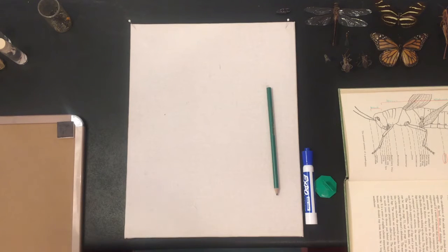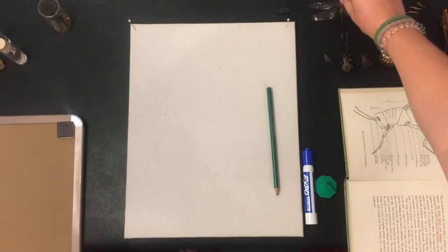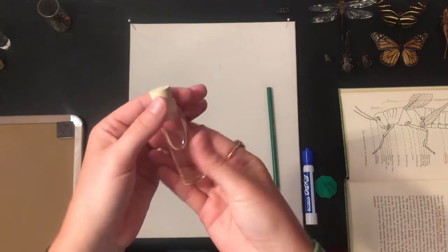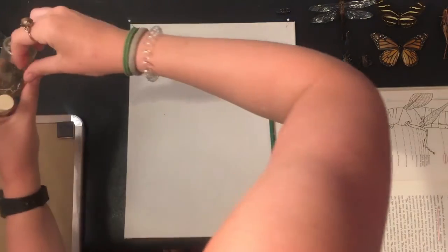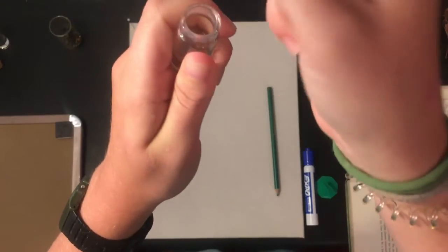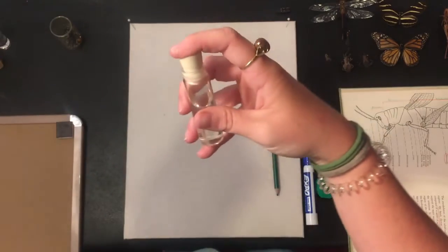Now I want to go over different types of curation, which is basically what pinning is. There is pinning, which has needles through it, and then you have vials. You can curate insects in vials — this is ethyl alcohol. You fill it up about three-fourths of the way with ethyl alcohol, and then so it doesn't burst you do something called burping. You take a needle and stick it in the side, put the cap on — that way it burps out all that extra air, and then you can pull the needle out.